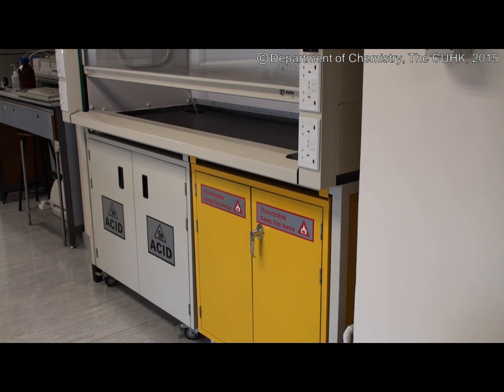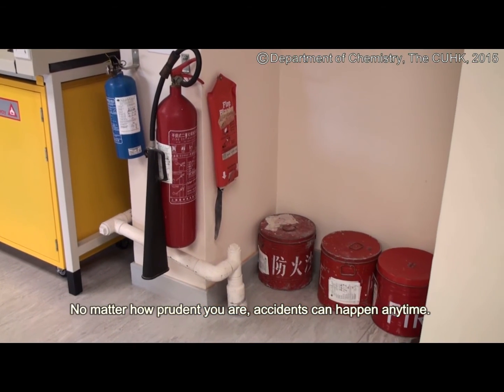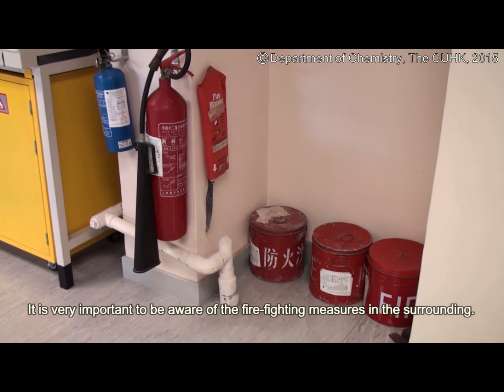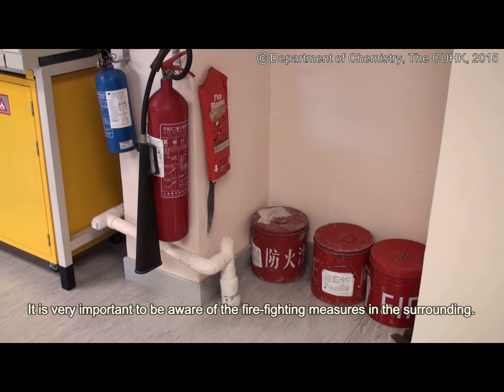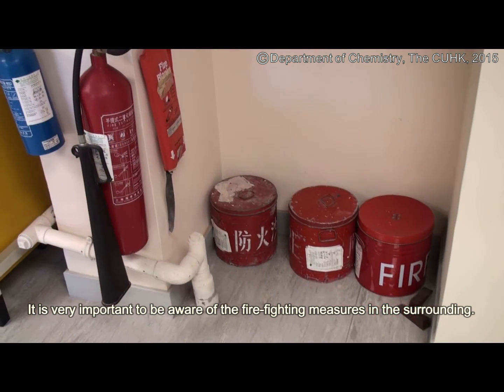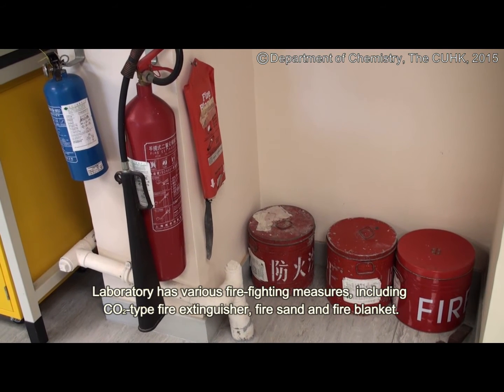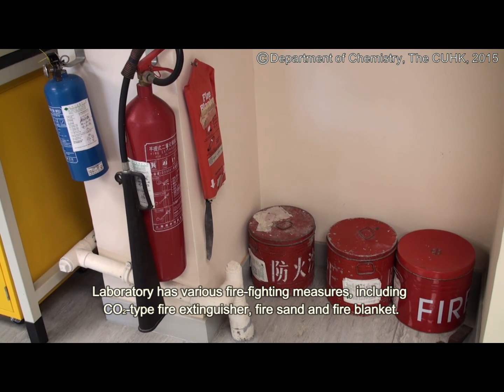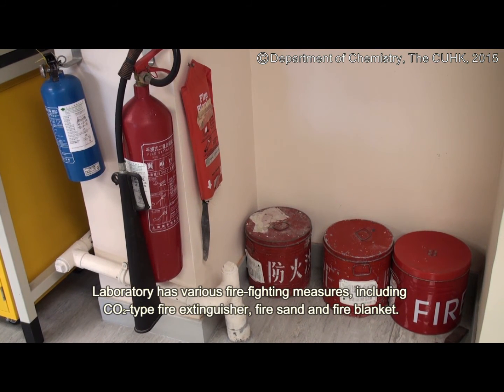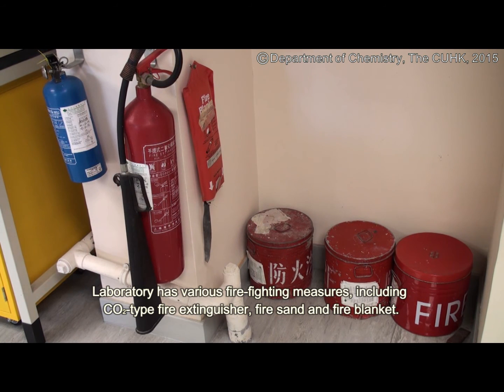No matter how prudent you are, accidents can happen anytime. It is very important to be aware of the firefighting measures in the surrounding. Laboratories have various firefighting measures including CO2 type fire extinguishers, fire sand, and fire blankets.